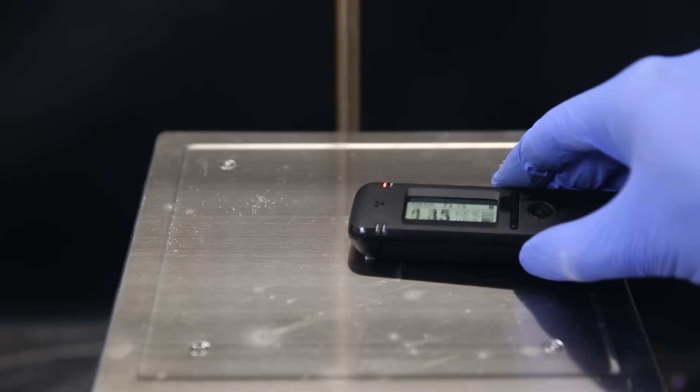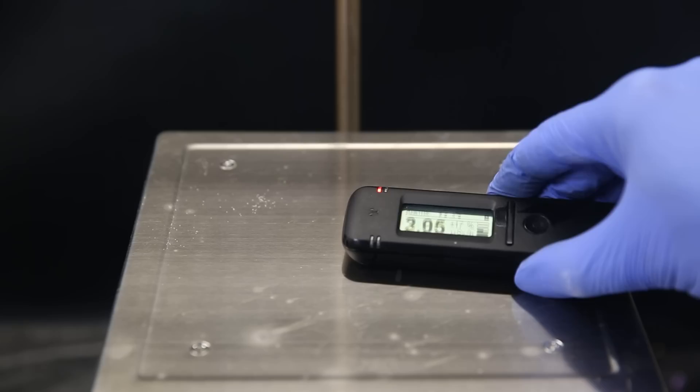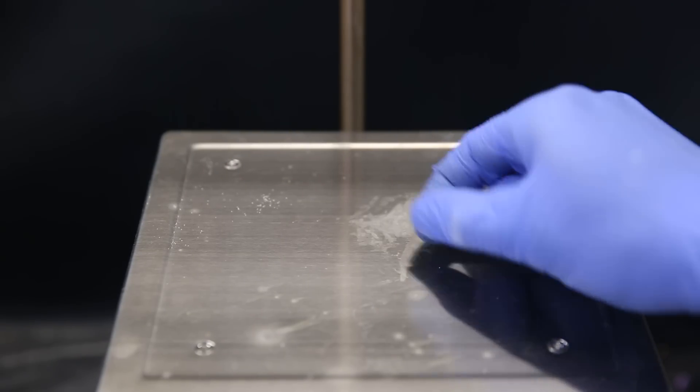If I take that piece alone and measure the radiation, it is definitely radioactive. But since it's such a small amount, it isn't super much. After a while, it also tarnishes slowly and gives off some black oxides. So it's probably a tiny amount of uranium.